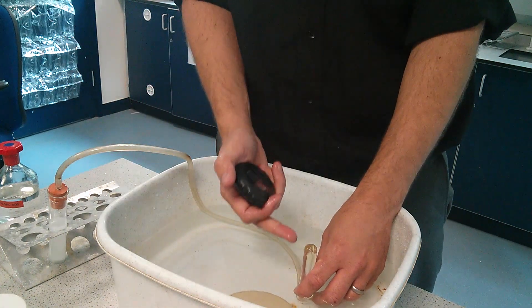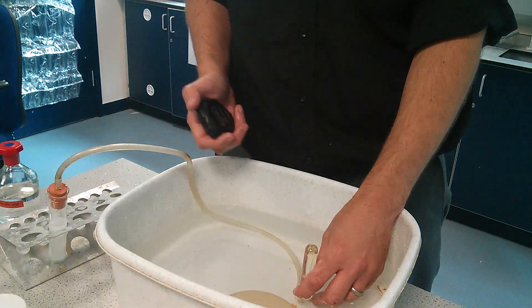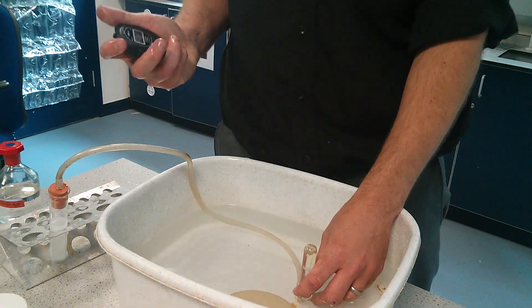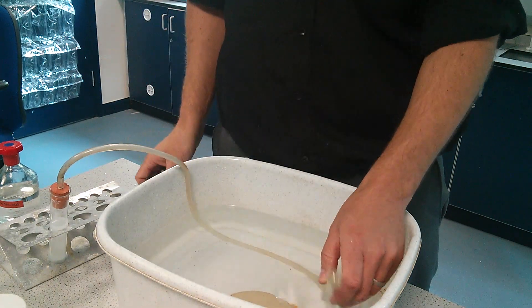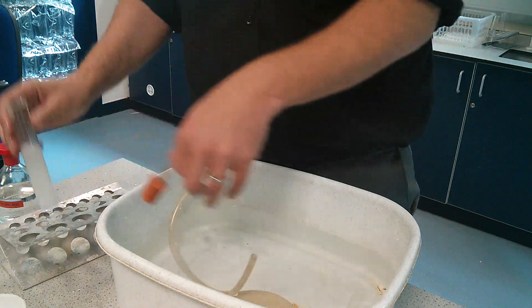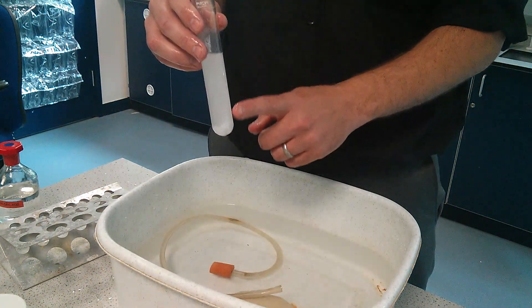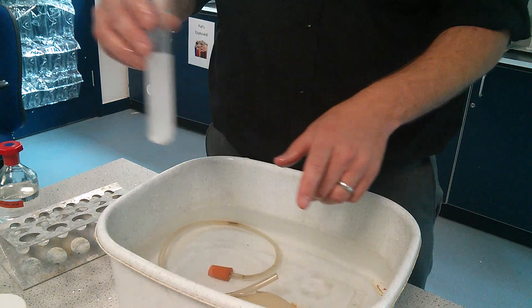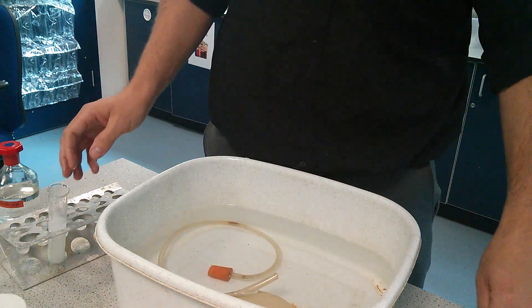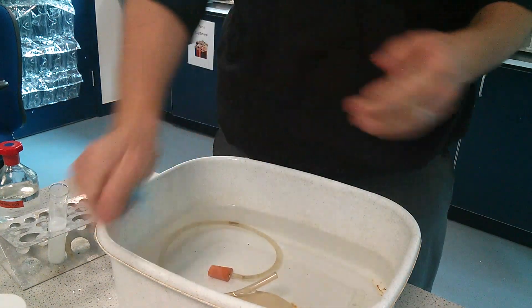We're going to record how long it takes for the test tube to empty of water. Once it's empty, take it and pour it through a sieve down the sink, then repeat the experiment with three different sizes of limestone.